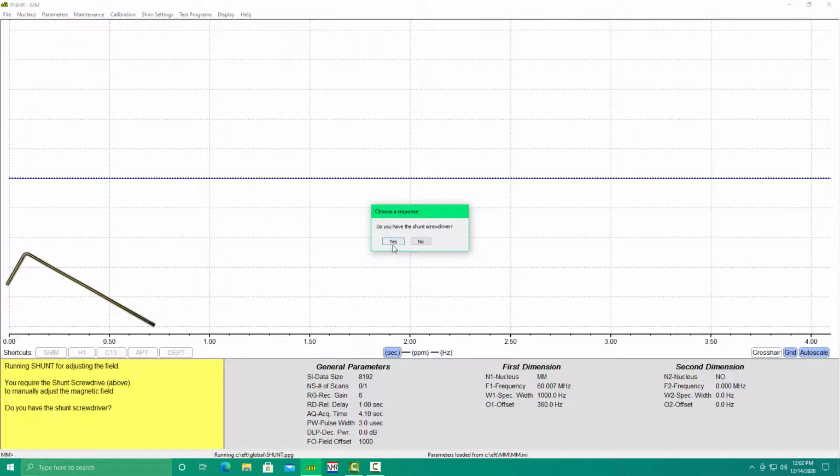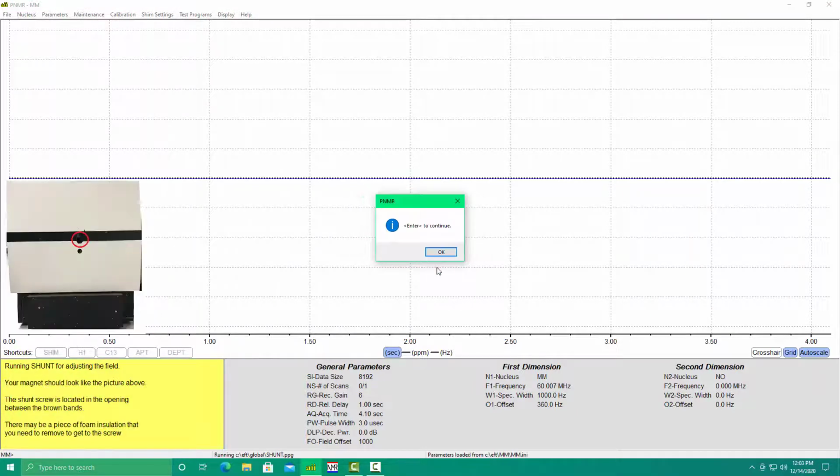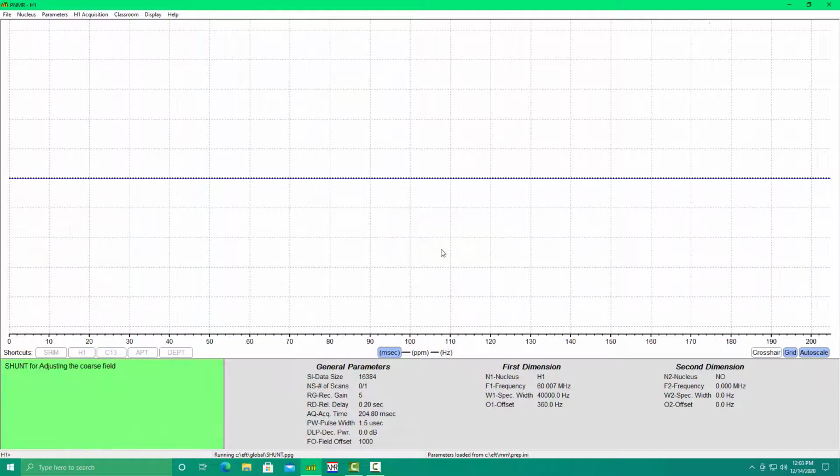We're going to need the brass shunt screwdriver for making the adjustment, and we're going to need a water sample in the magnet so that we can see the field adjustments as we make them. On this particular magnet, the shunt routine is going to be done on the side of the magnet between the brown bands. Other magnets, the program will tell you where to do the shunt.